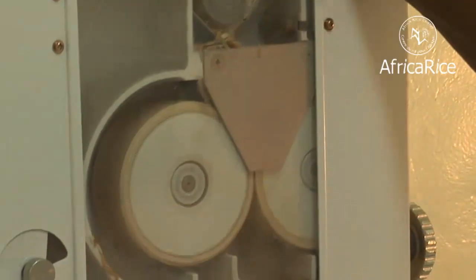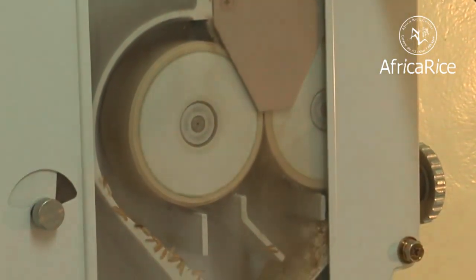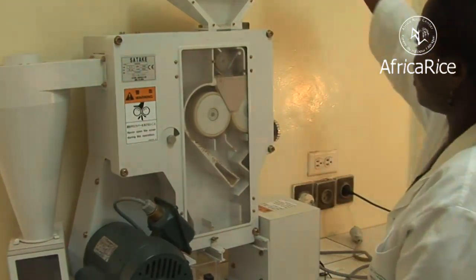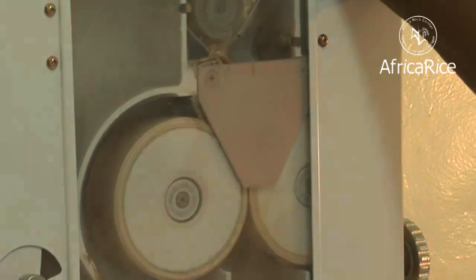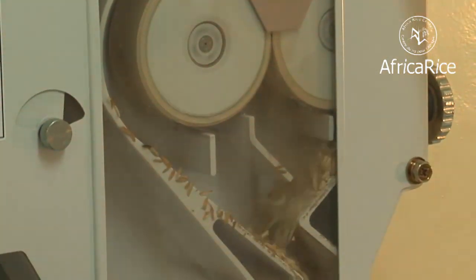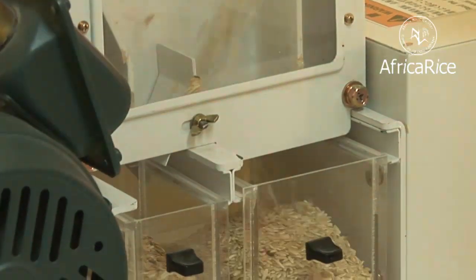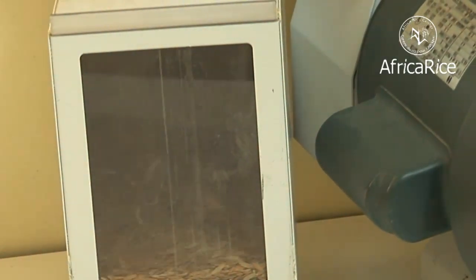The lab dehusker is made up of two rubber rolls rotating in opposite directions, with one moving at twice the speed of the other. This setup ensures that paddy grains passing through the rolls are dehusked. The dehusked brown rice collects in a receptacle, and the husk is aspirated into another receiver.